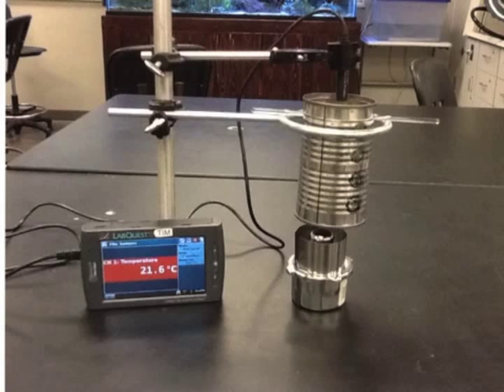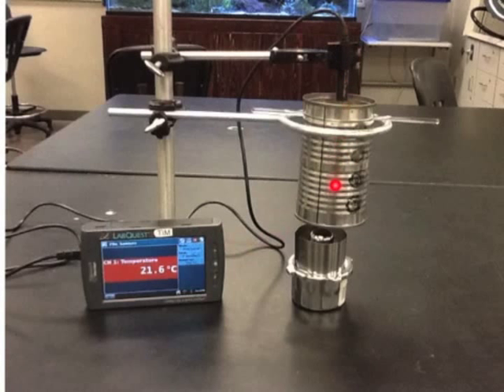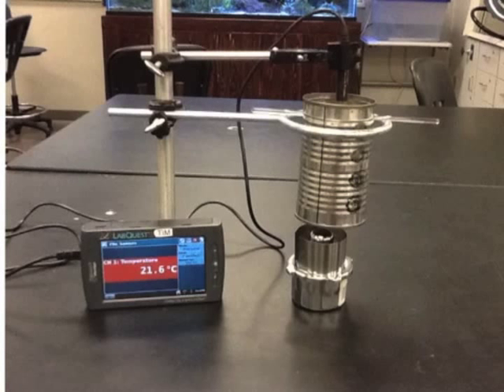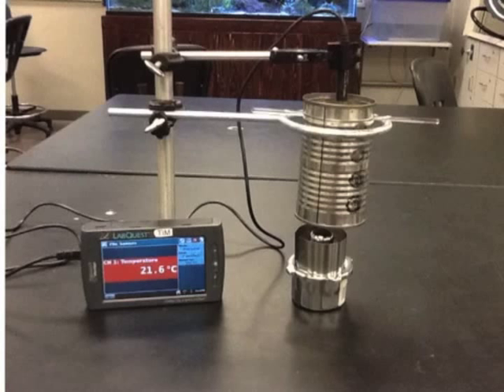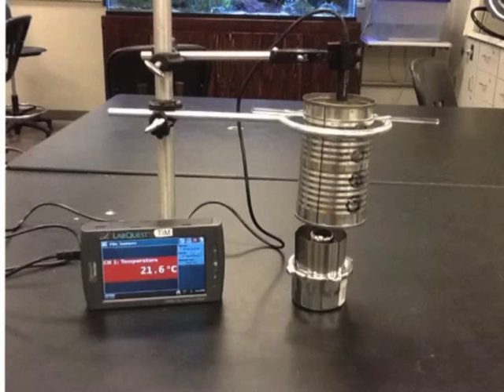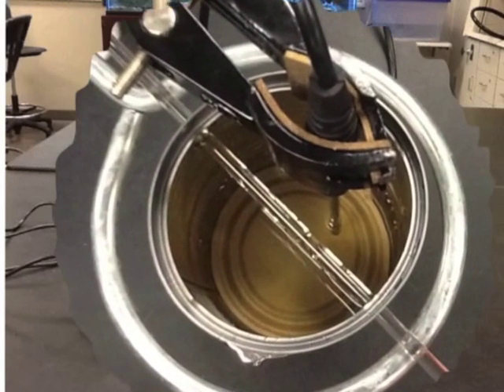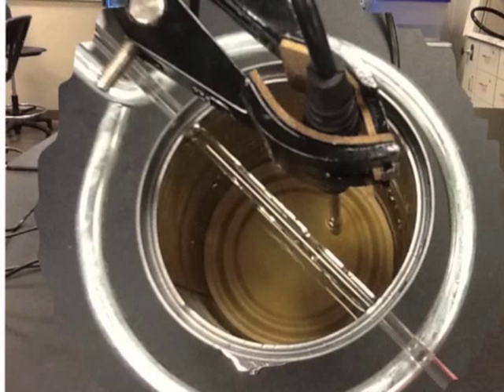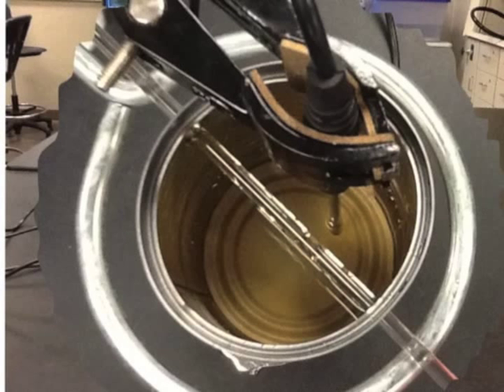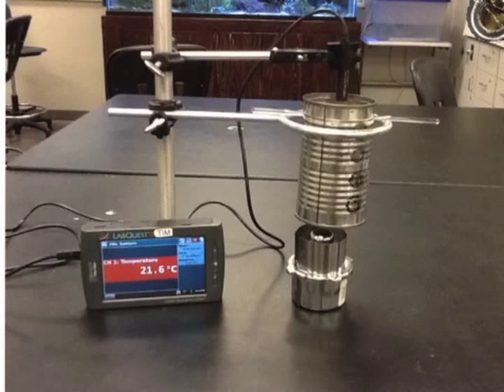Now it's time to hook up your LabQuest device to a temperature probe. Put the temperature probe through a clamp and get it into the water in the can, but don't put the temperature probe all the way to the bottom of the can. As you can see in this close-up picture, the probe is in the water but not touching the bottom. Record the initial temperature and you'll be ready to start.